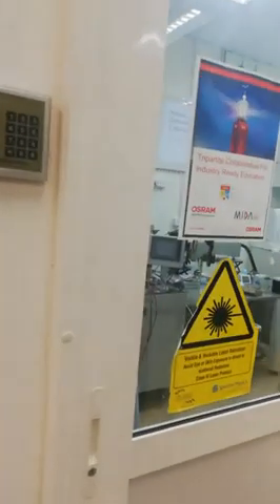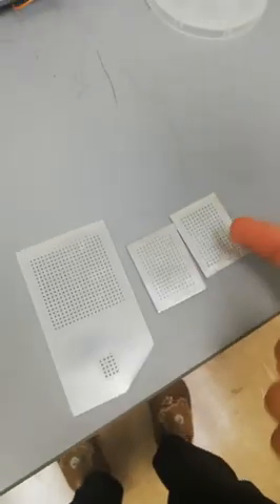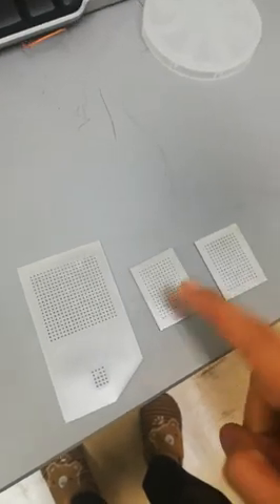You need a shadow mask for your top electrode to make some electrodes so that you can use the probes on those typical electrodes. You can also simply make a kind of thin film layer. Normally what we do is we use shadow masks of different shapes and designs to make our top electrode. We are going to use these aluminum masks for our top electrode.